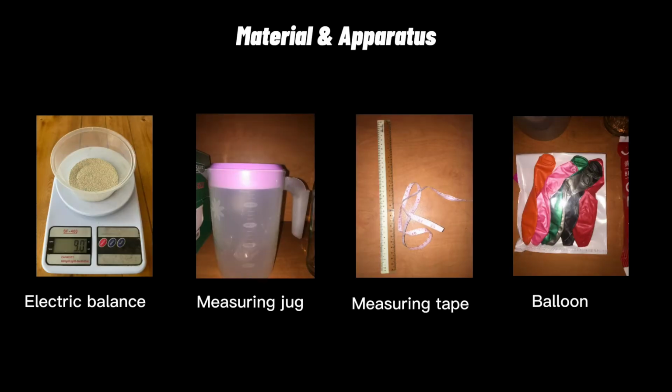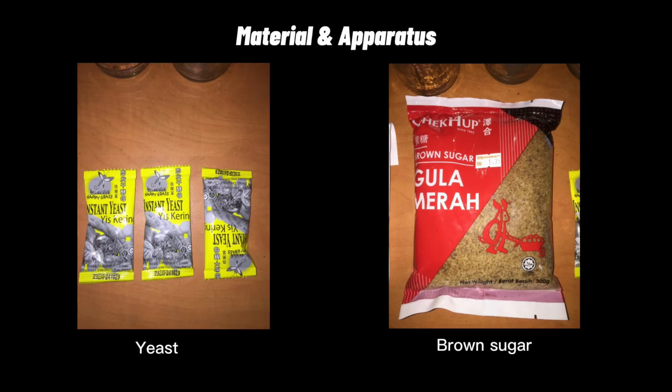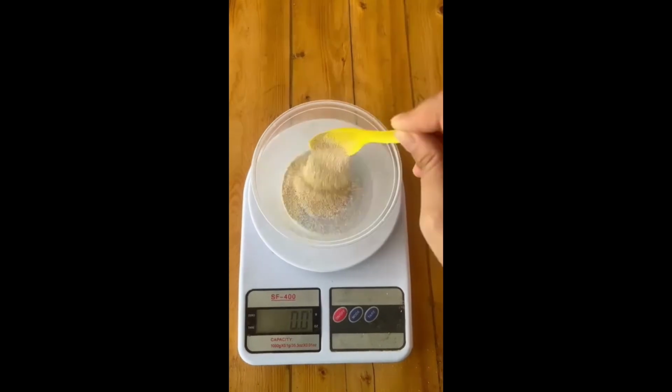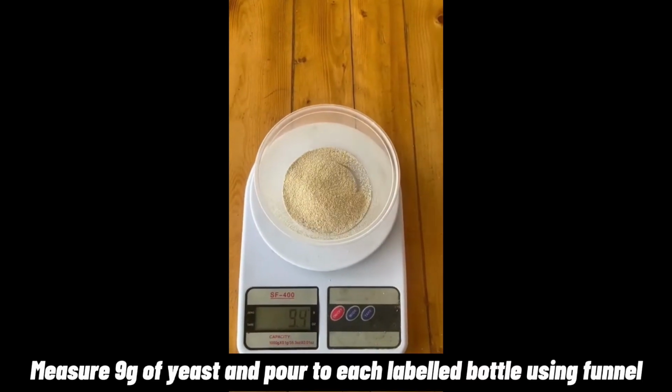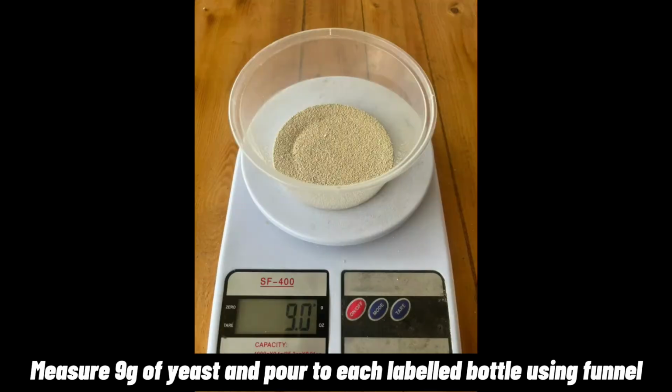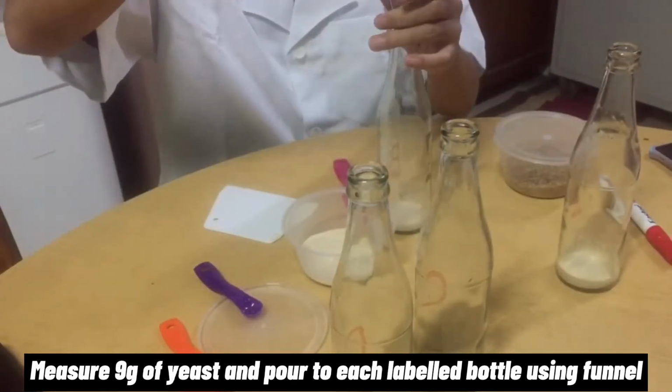Firstly, prepare the material and apparatus that are needed as shown in this clip before we start our experiment. Next, measure 9 grams of yeast that we already set as our constant variable and put the yeast into each of the labeled bottles by using the funnel.